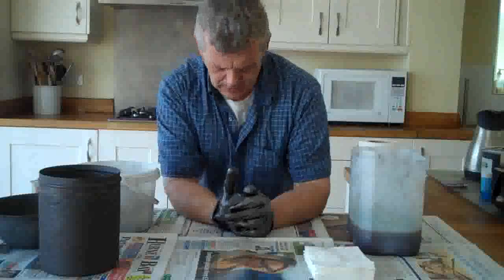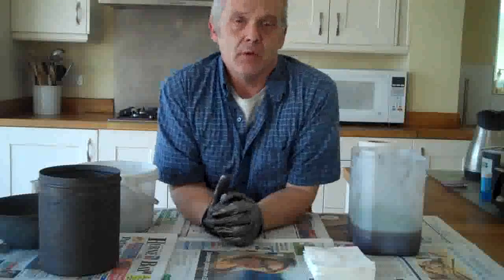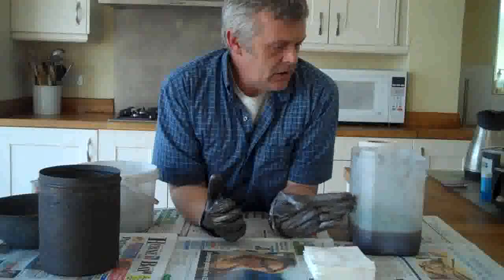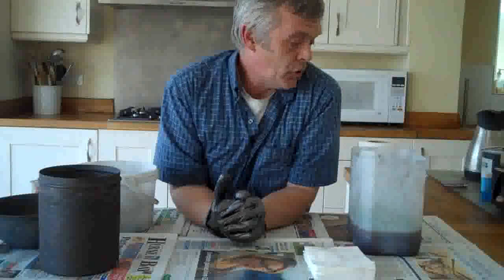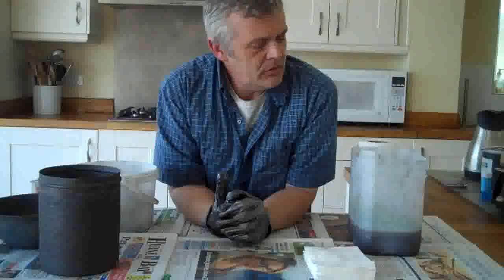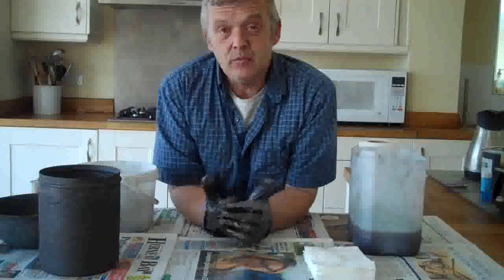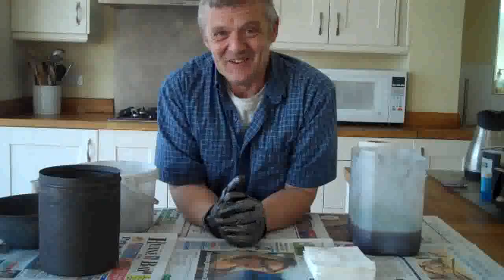I've been doing quite a lot of nickel-assisted catalytic graphitization and I recently decided to give it a go with iron, just out of interest. I've got here a tub with iron chloride in it, and in there are some blocks of normal timber that I've been soaking for three days to make sure the iron chloride is soaked up into the timber. I was just about to catalytic graphitize those, and it occurred to me that wood is basically cellulose — toilet paper is basically cellulose. So let's give it a go and see if we can make a toilet paper battery.